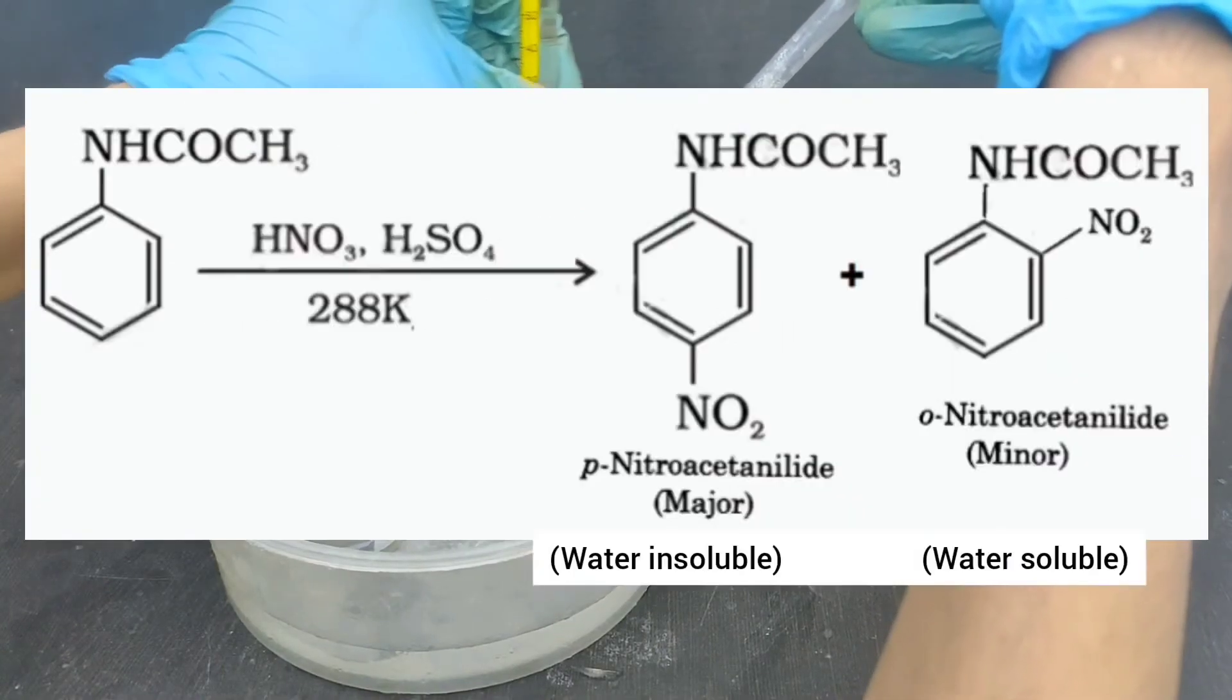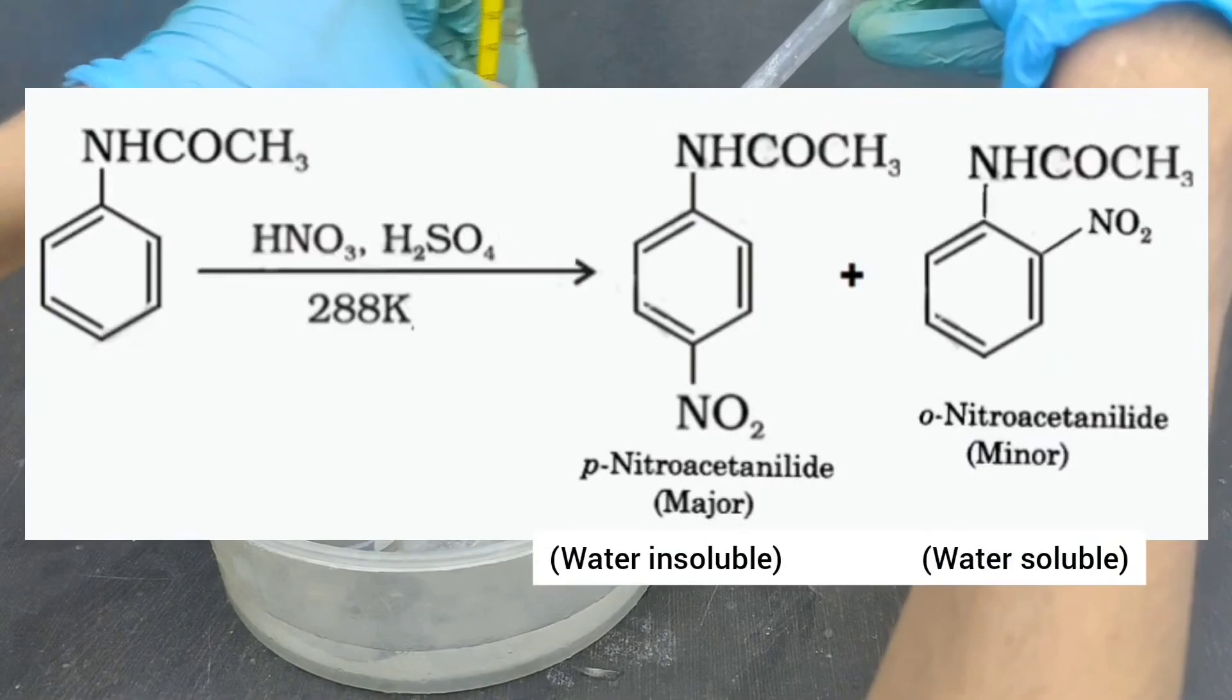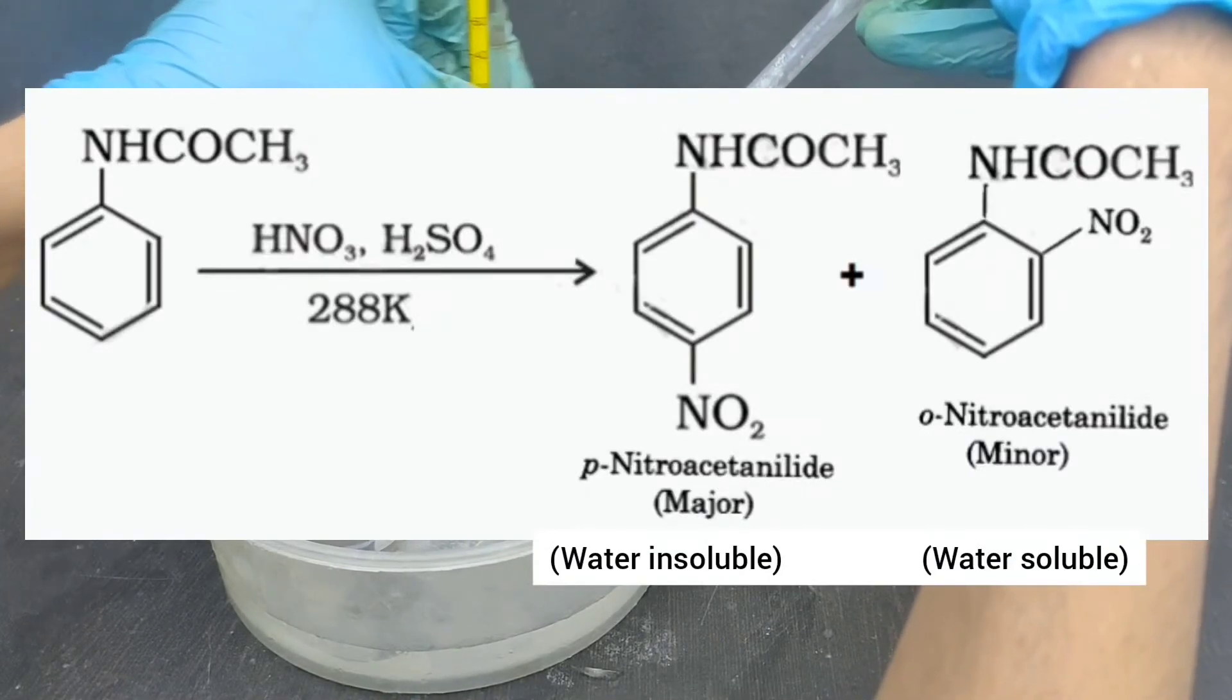The ortho nitro acetanilide is water soluble. Hence, it can be separated by water.